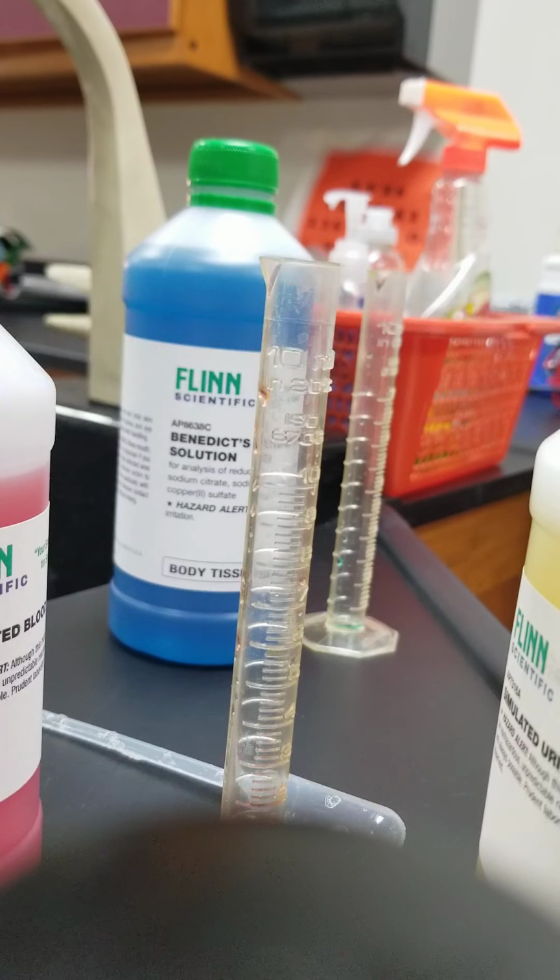And I'm going to use an instrument called an inoculation loop, which hopefully you can now see on the camera. It's just a little piece of wire that has an opening on one end. So this is called an inoculation loop. We actually use it to put bacteria on plates. This one has not been used for that, but we can do flame tests with them as well in chemistry.